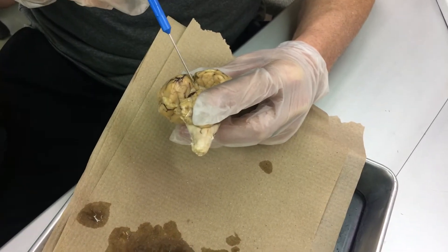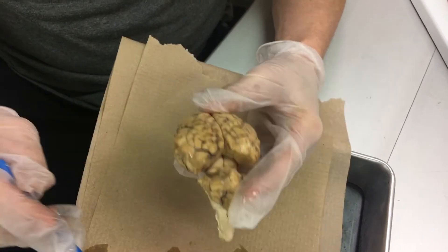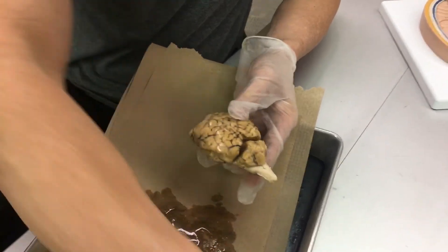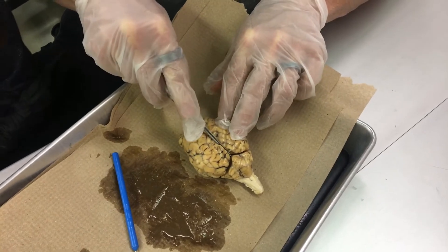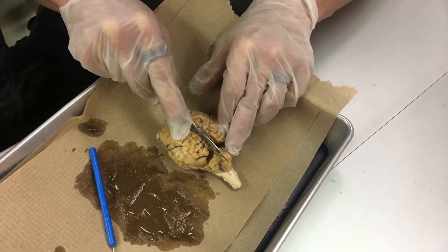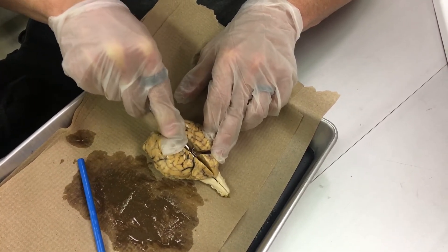The pineal gland is right here, which secretes melatonin. So let's go ahead and do our first cut, which will be a sagittal section separating the two hemispheres — the right and left hemisphere. I'm going to separate the cerebellum and cut through the brain stem.